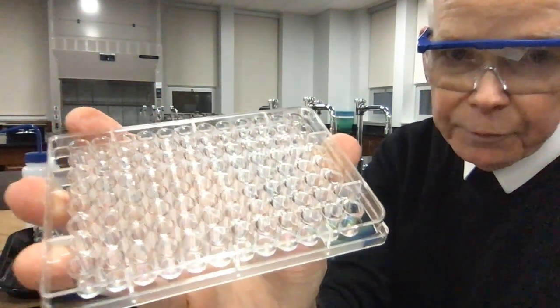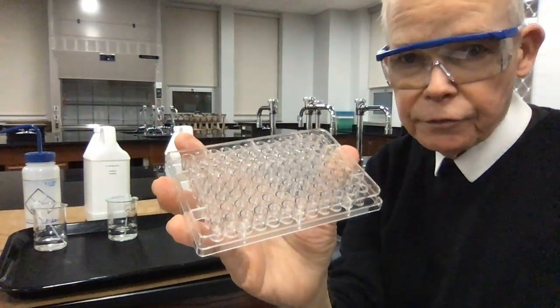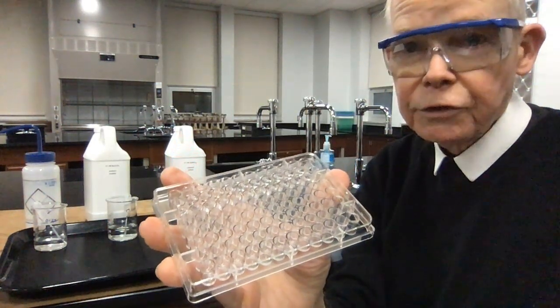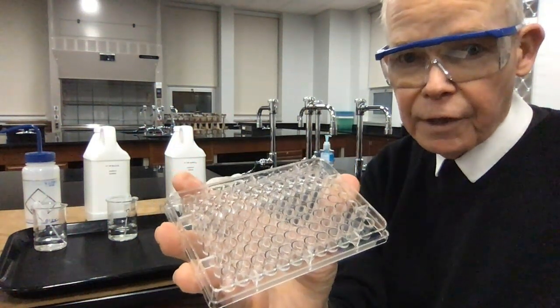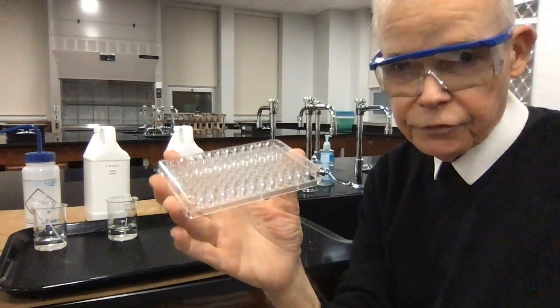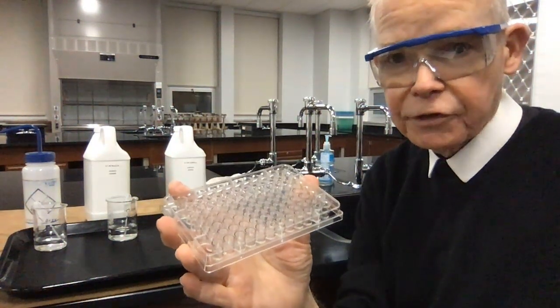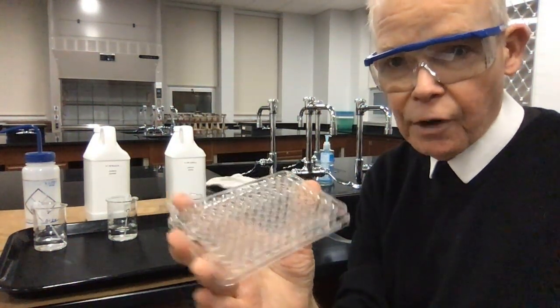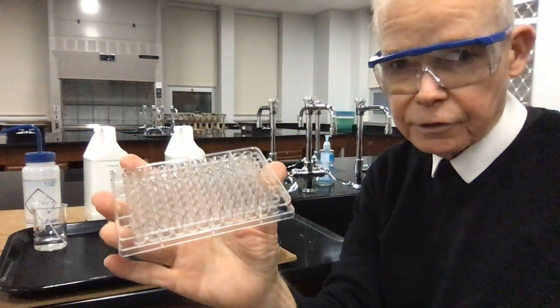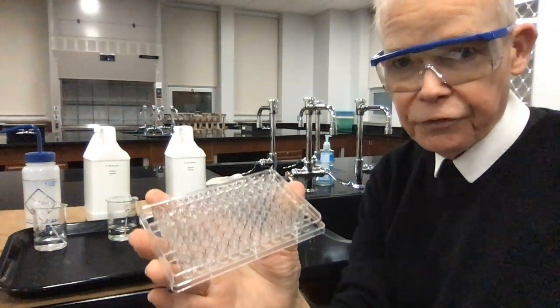This kind of equipment is used very much in hospitals. It's used to analyze things in industry, where you can do a whole bunch of analytical work at one time. And right now with the virus, these kinds of tools are very useful for testing a lot of samples in a short amount of time with automatic machinery. It can put a bunch of testing samples into a little well plate like this. So it's very convenient for us.